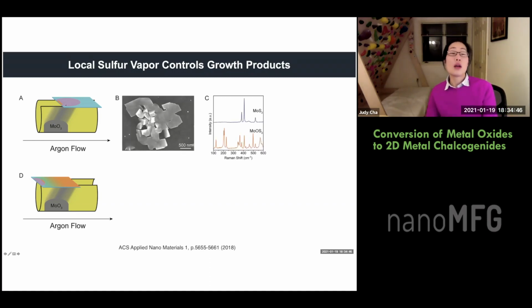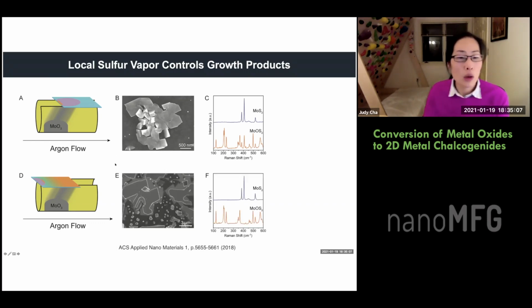So here, when you put the substrate a little bit to the right, what ends up happening is that there's slightly more moly vapor. And then he would grow these crystals that are definitely not moly sulfide. And when you do Raman, we can identify it as moly oxysulfide. And then when he moves the substrate to the left, you're not getting as much moly vapor. So in comparison to the sulfur, now you're creating a sulfur-rich environment so that you're going to get moly sulfide. So you can see these triangular moly sulfide flakes along with the moly oxysulfide intermediate products.